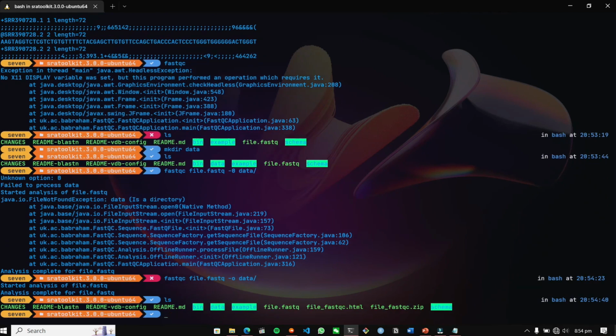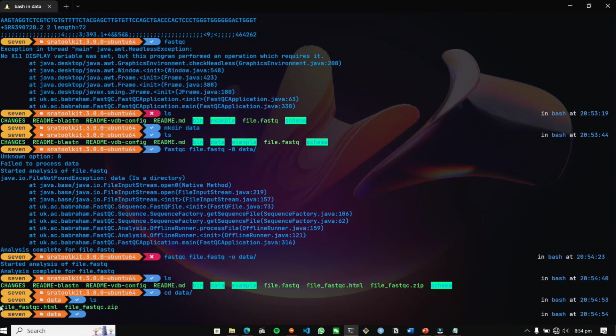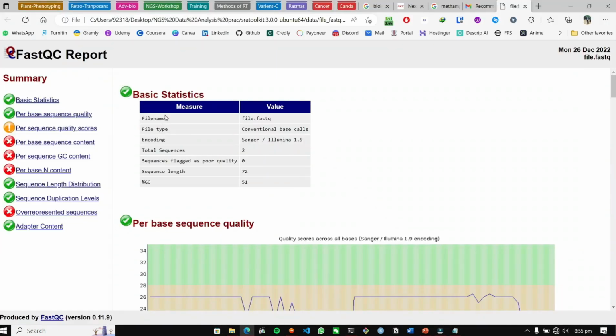Now I'm going to ls, and move to the data folder. Yep, the file's HTML report is the result that we need. So moving into this folder, we have our data. Here you can see the file name that we used.